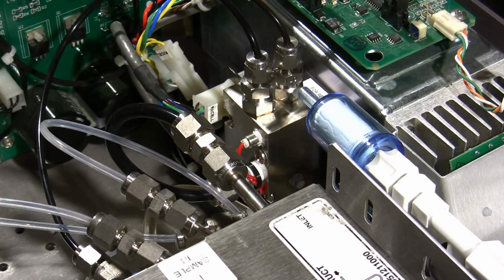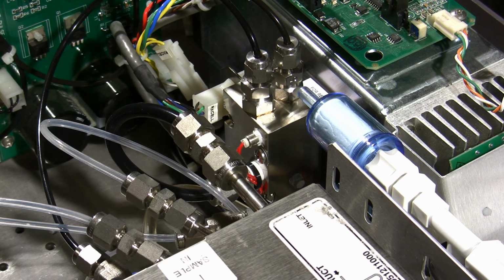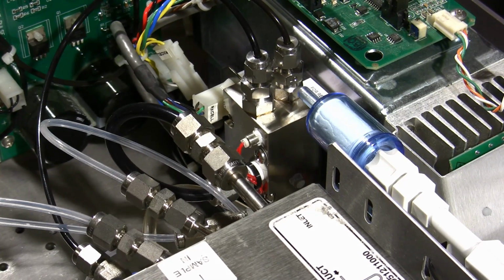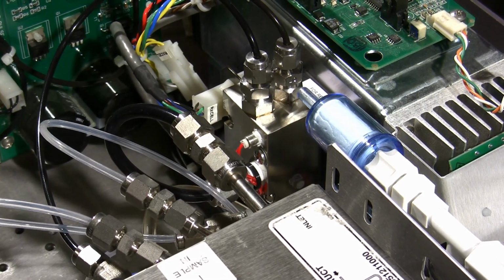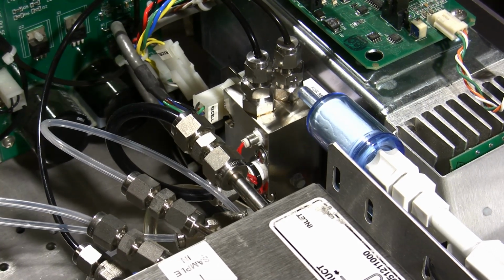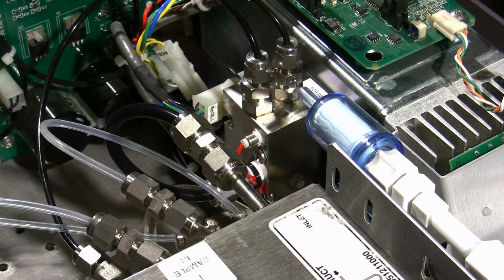This analyzer has started experiencing drift issues with its nightly calibration check. So we're seeing, while we're running, say, a 15-minute nightly span check, that at the end of that 15 minutes we haven't truly lined out or reached our target. The response is still climbing during that period as we switch from our ambient air to our calibration gas. Typically that could be the permeation dryer on our ozone generator getting old. This one actually looks okay visually. Most often it's going to be that the reaction chamber has just gotten dirty and it's time to clean it.